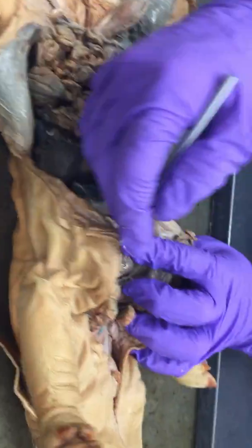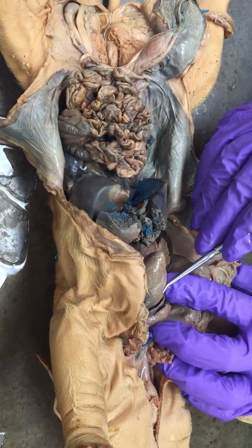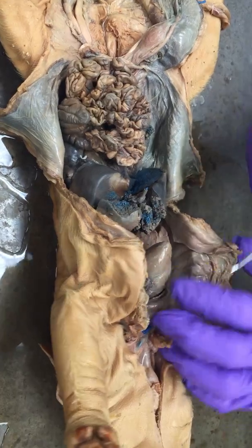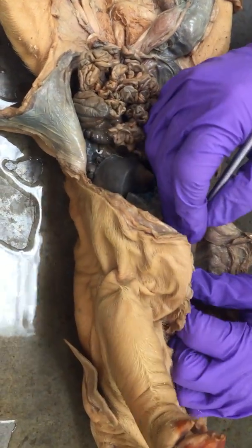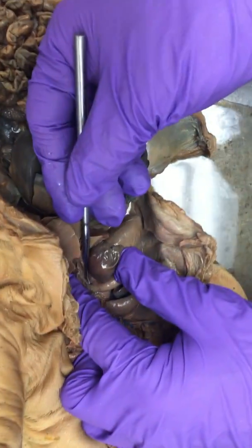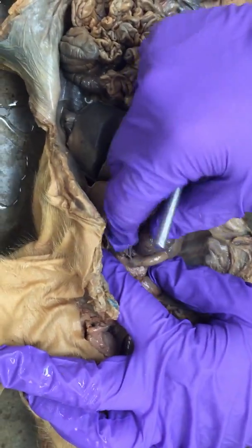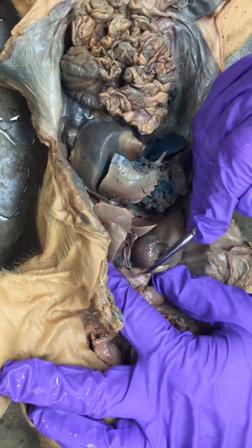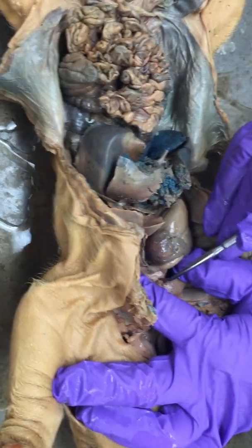And they're shunted by two ways, but one way that blood is shunted is directly from the right ventricle straight into the aorta. And that connection straight into the aorta, which you can see right here, is the ductus arteriosus. So, define shunted. Sent or bypassed.